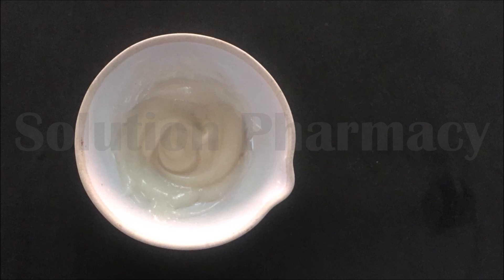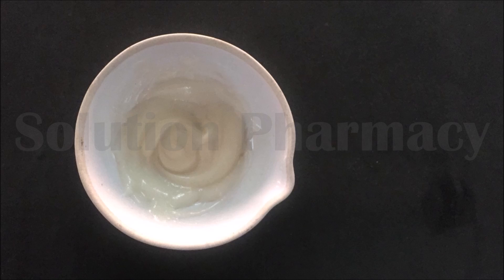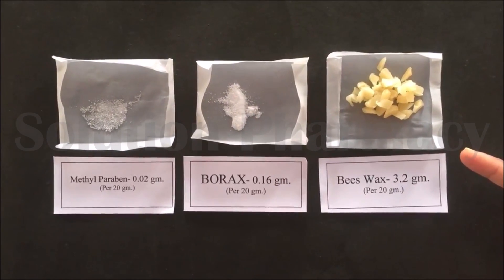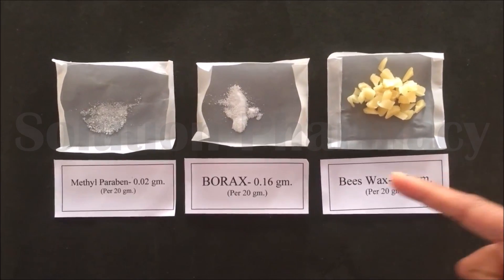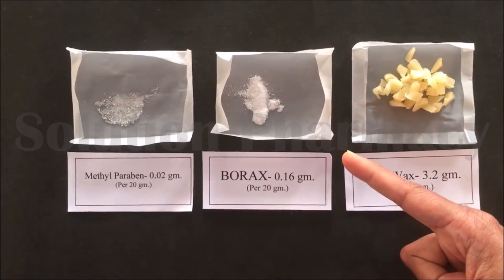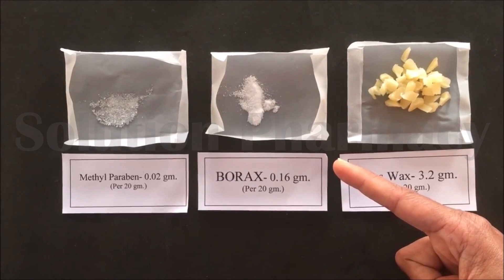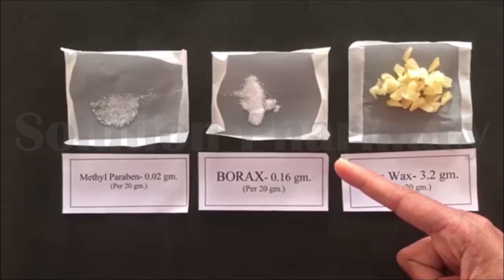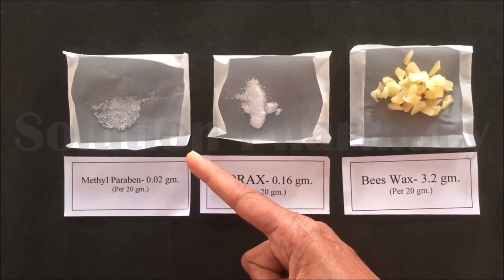Now let's know the ingredients used for the preparation of cold cream. The first ingredient is beeswax — here we have weighed 3.2 grams of beeswax for the preparation of 20 grams of cold cream. The next ingredient is borax — here we have taken 0.16 grams of borax. We have weighed all the ingredients here for the preparation of 20 grams of cold cream.